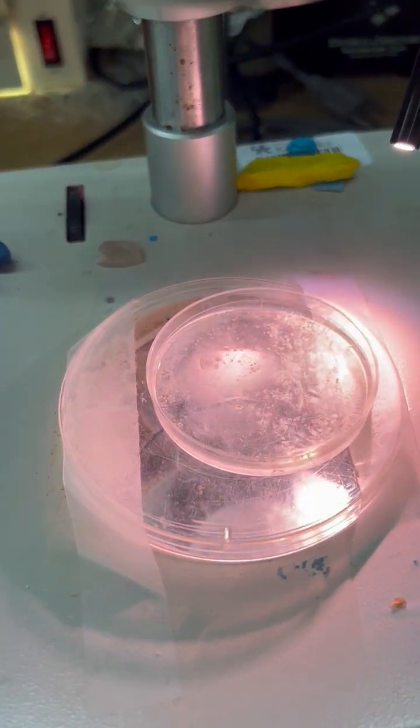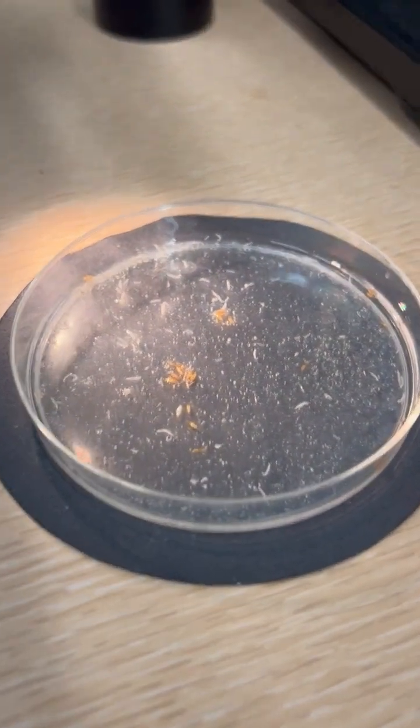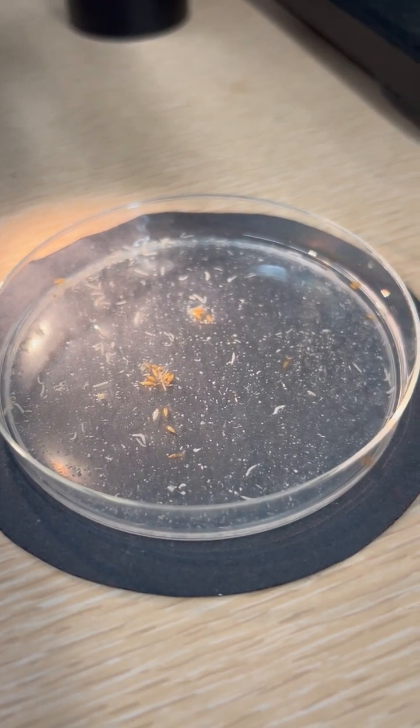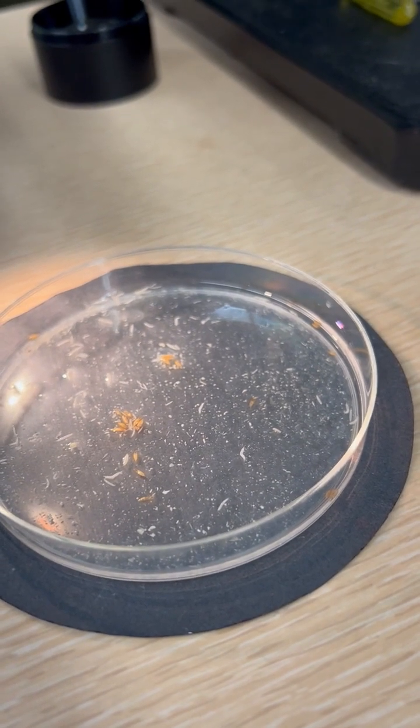And then we had behavioral assays over here where they could look at mouth hook movements of Drosophila and they could count them, and then we could do something where they would change. And then we showed them all the different developmental stages of Drosophila and body wall locomotion that's used for an assay as well for looking at effects of synaptic transmission or mutations.